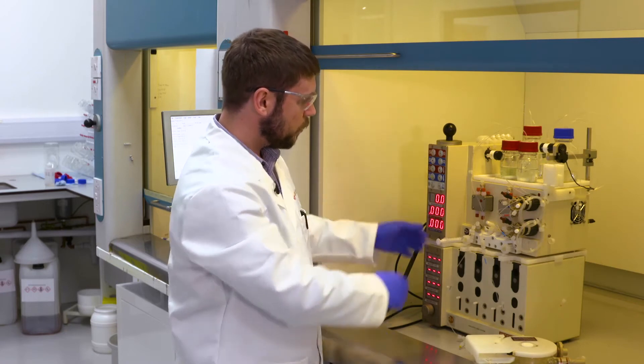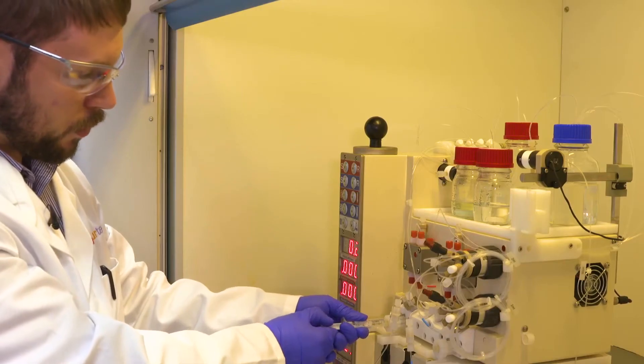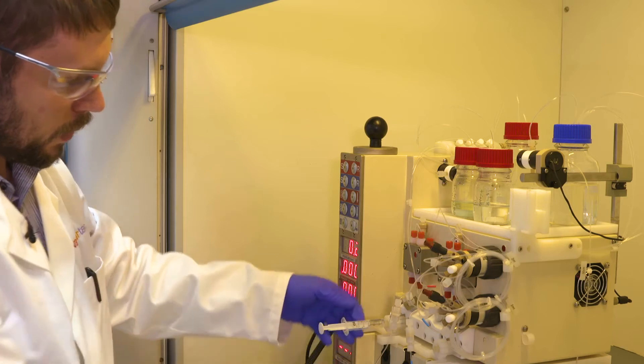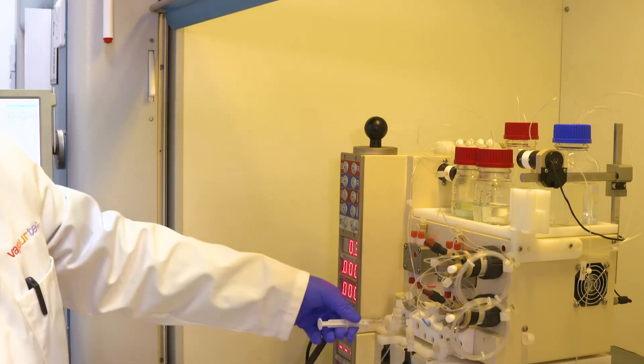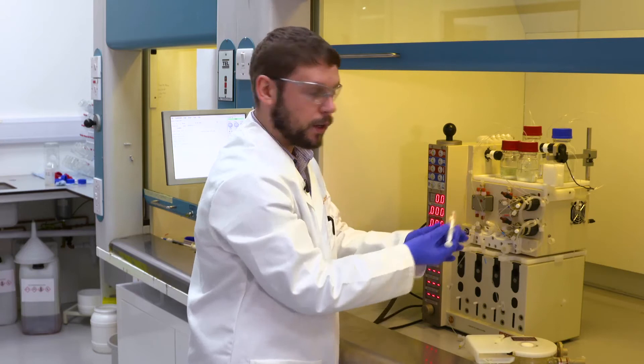Then I switch back to the solvent and pull the solvent through the pump. Then I can close the valve just until it's finger tight and the pumps are primed and ready to go.